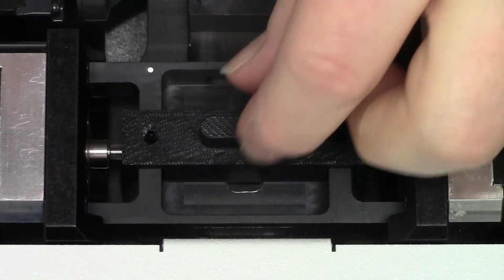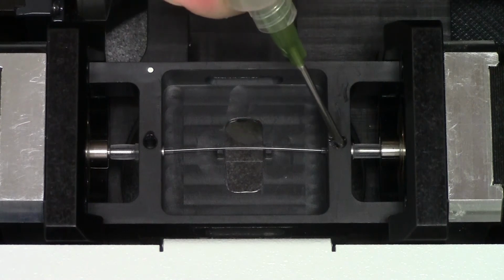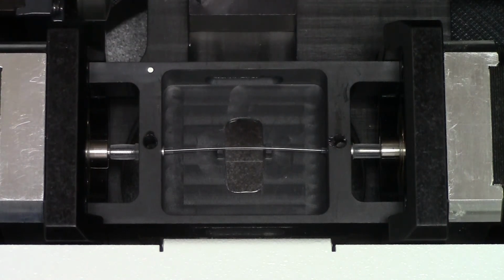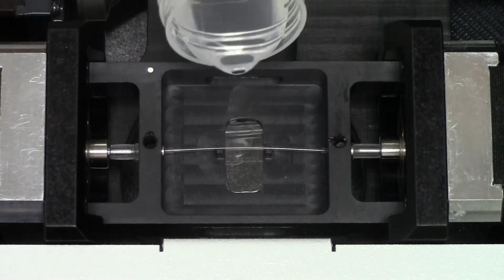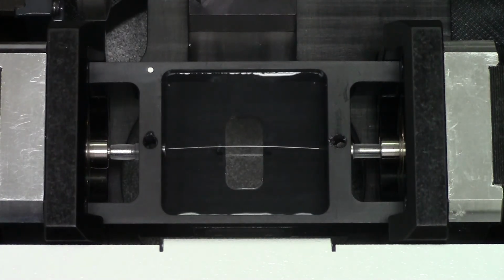Finally, remove the guard and add a small amount of lubricating sealant at the collars to prevent water from leaking out of the tray. You may want to perform a test rotation to ensure that all mechanisms are working properly before priming and cleaning the new capillary.